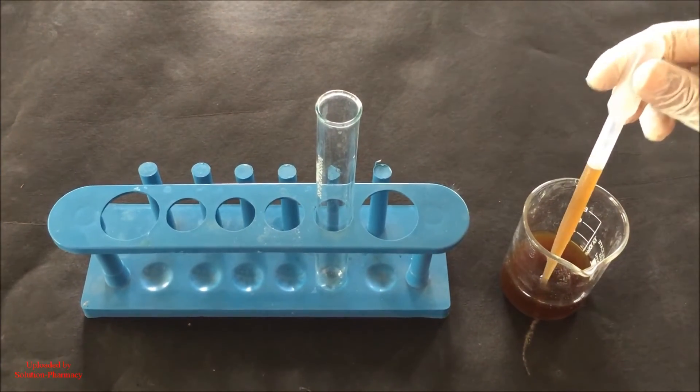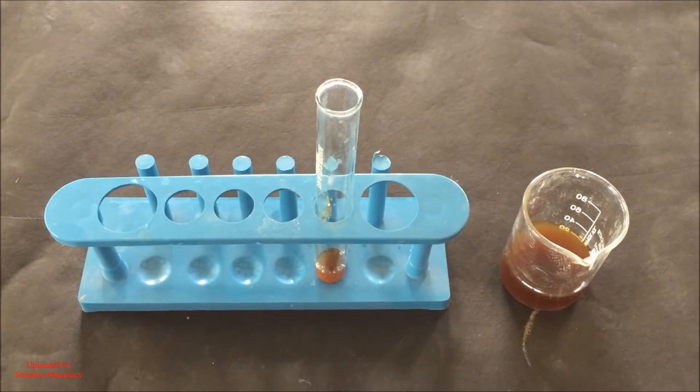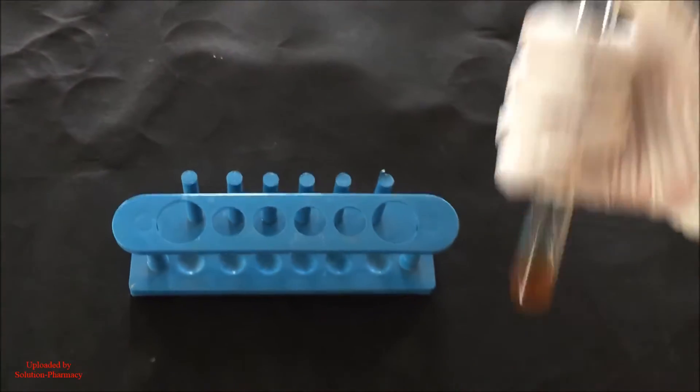We have collected aqueous extract in a beaker and then transfer about 2 ml of the aqueous extract in a test tube. After transferring 2 ml of the aqueous extract, shake the test tube.